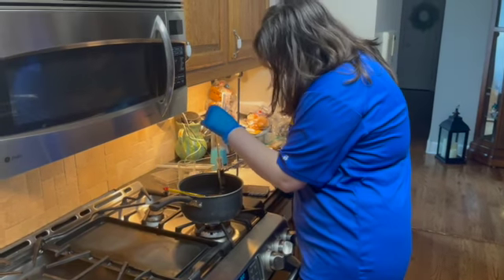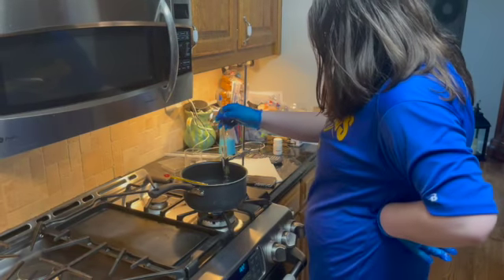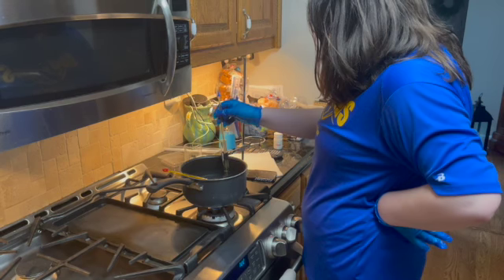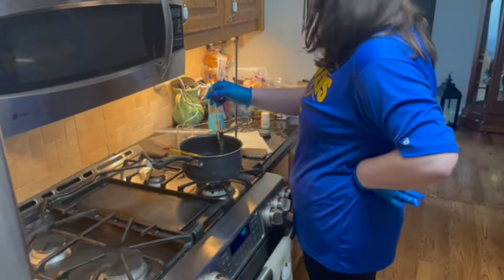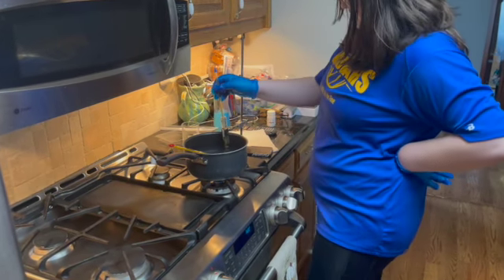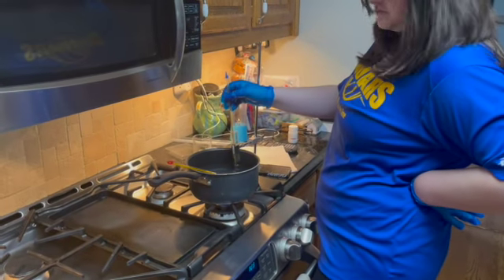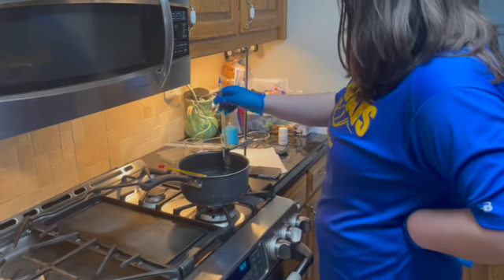Yeah, it is almost all the way melted through in a matter of 3 minutes. There's still some left because I can see it based off of it being a more solid color compared to whenever naphthalene is melted into a clear liquid, just like paradichlorobenzene.